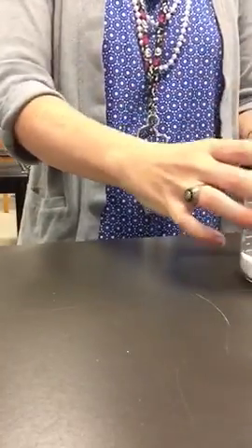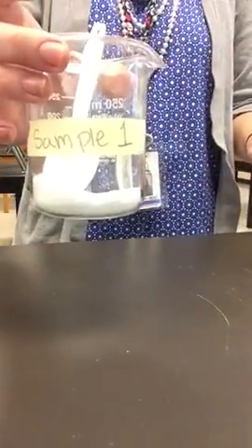So first you need to observe, and I'll go back through. 1, 2, 3, and 4. Go back and observe each of them and make your hypothesis. And now I'm going to go through and mix each one together.